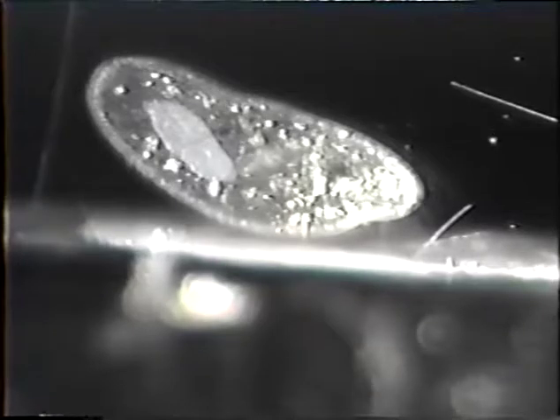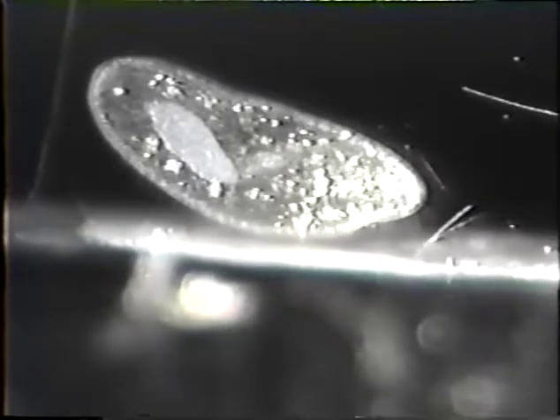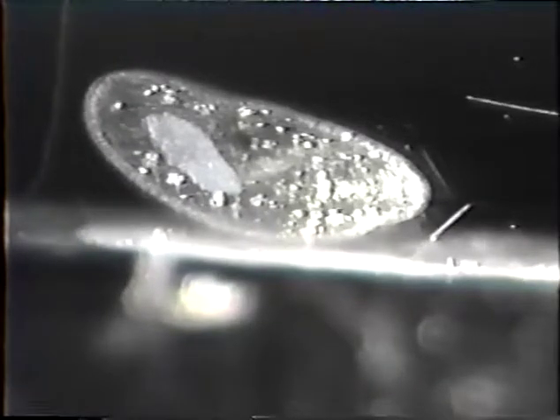This is a paramecium, and he's under the influence of his MOR. The body's slightly swollen. The MOR of this particular organism is 1150 cycles, and typically they are not motile when they're fully under the influence of the MOR.